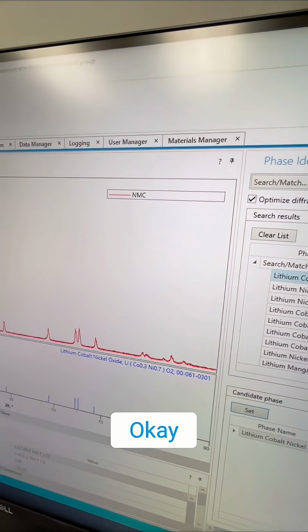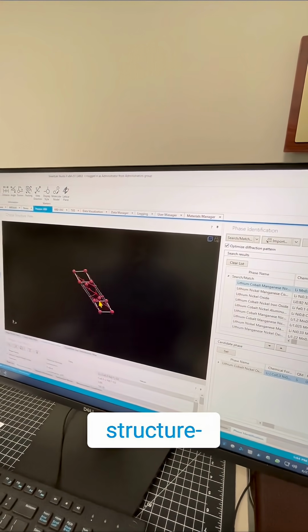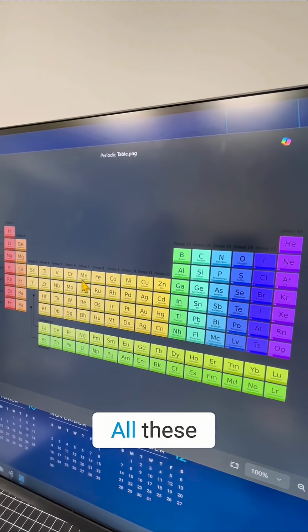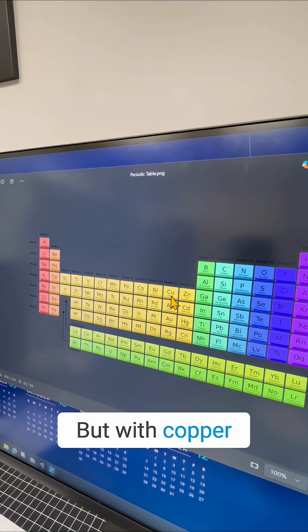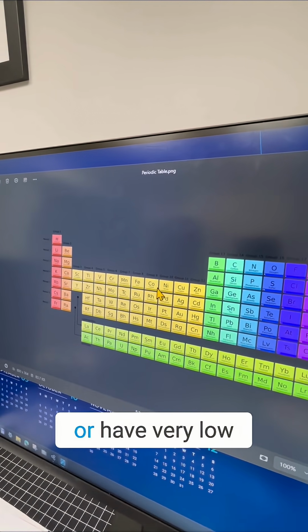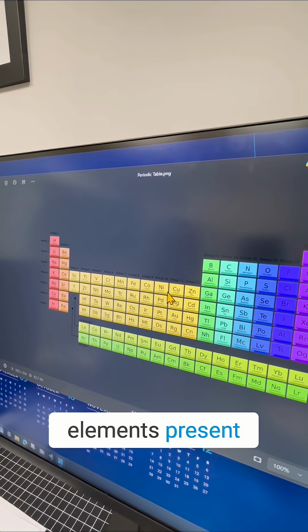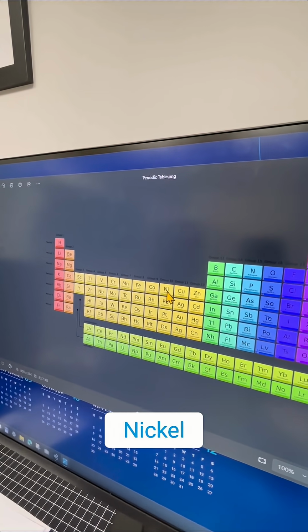And just for fun, here's the crystal structure. All these elements will cause fluorescence with copper X-ray, but with a copper source and using this detector, you can avoid the fluorescence or have very low fluorescence. We almost saw nothing with these elements present, anywhere from manganese up to nickel. Nickel. Okay. Correct.